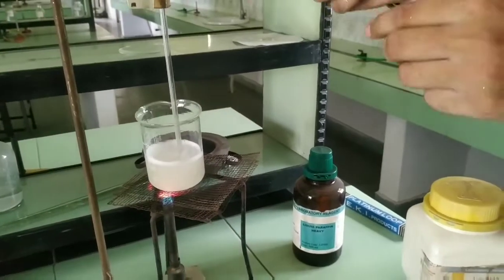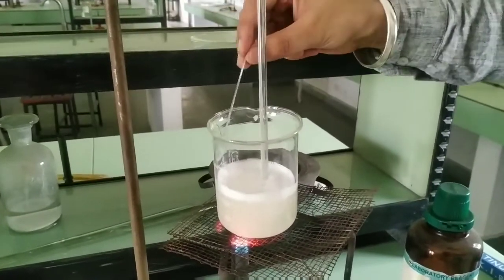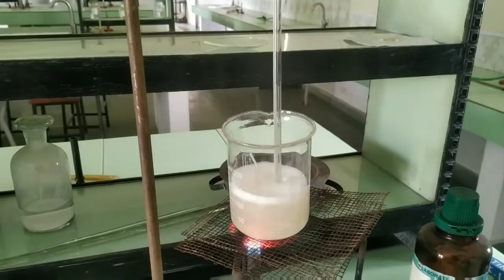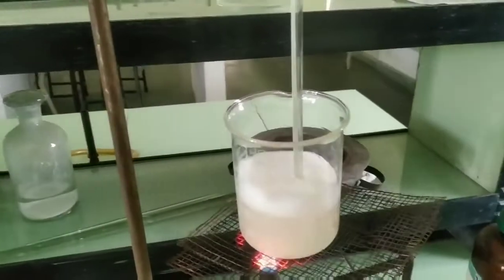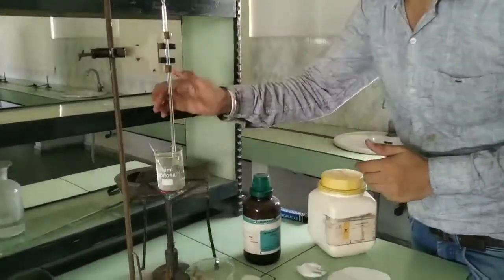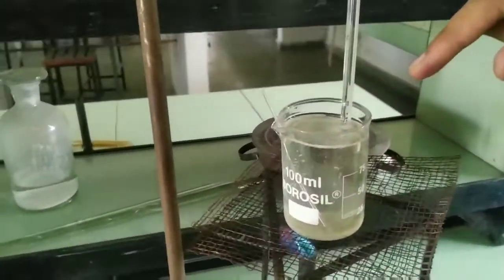I have just closed one end of the capillary tube so that it is closed from one side. After that I will put this in the beaker. We have to check that the salt in this will melt. You can check here — I have placed the capillary tube filled with the salt in the liquid paraffin.